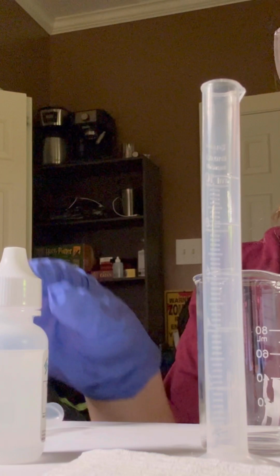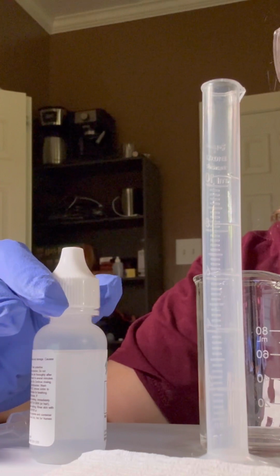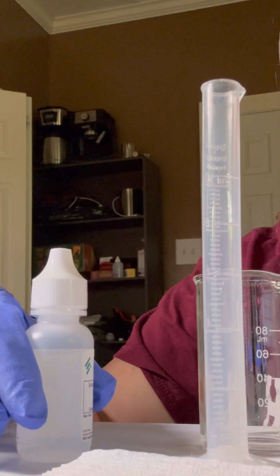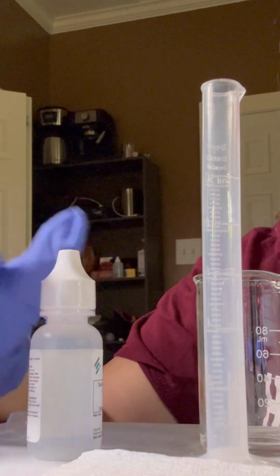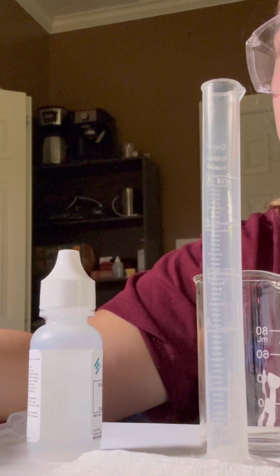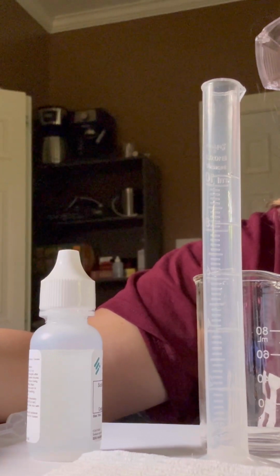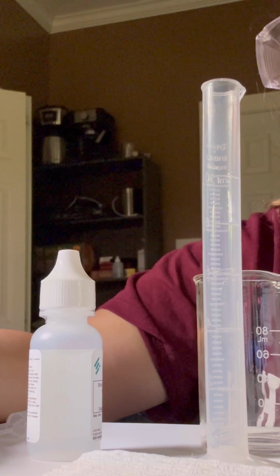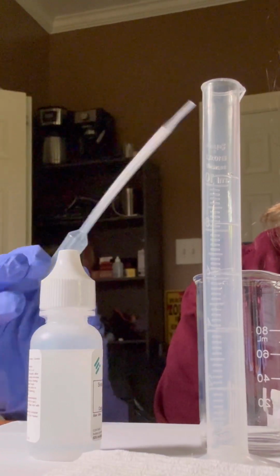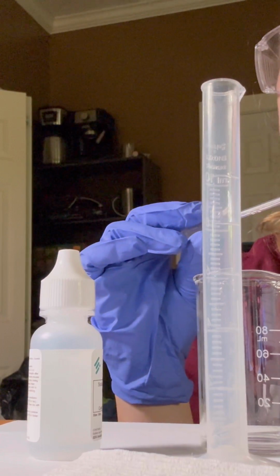So we'll take our other pipettes. It says to carefully remove the cap from the bottle and remove the dropper insert from the top of the bottle. Then we gently bend the dropper tip to the side and move it back and forth to separate the tip from the bottle. We place the tip to the side, leaving the bottle of NaOH open at the top. Now we place the tip of the empty short stem pipette into the sodium hydroxide bottle and fill the pipette with the NaOH.